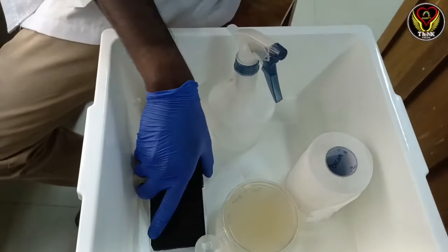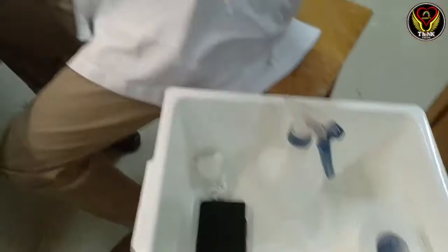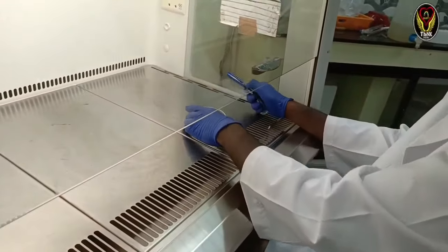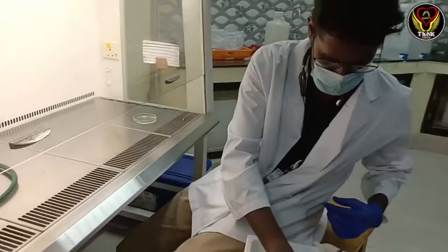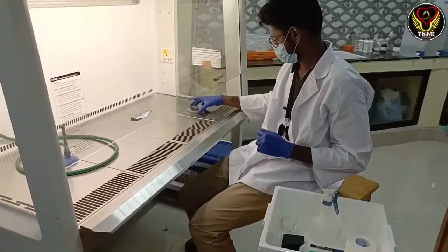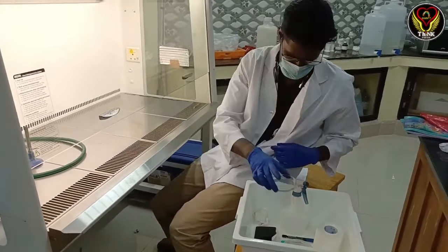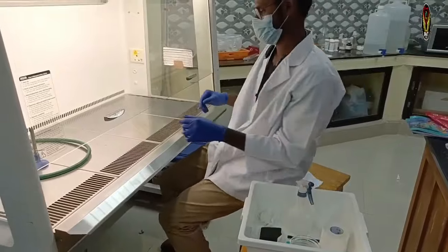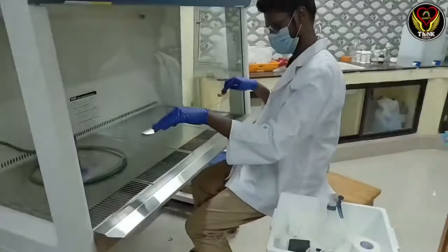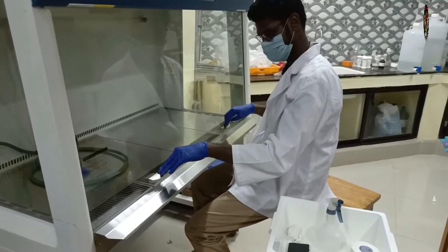I will clean the workspace and organize everything. I will clean everything and then complete the procedure.